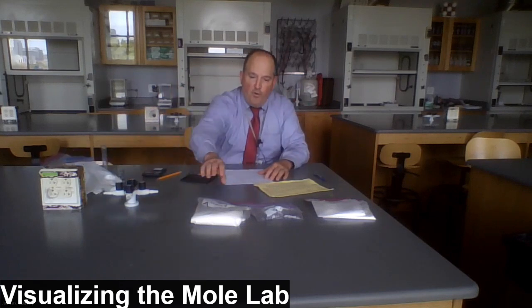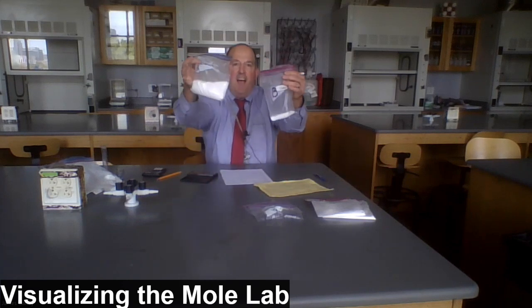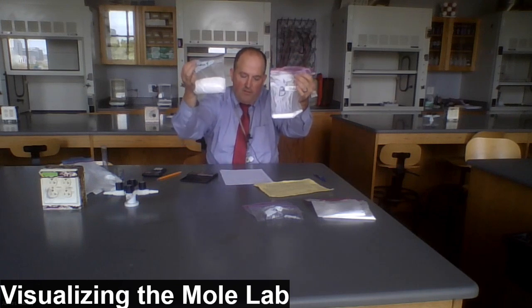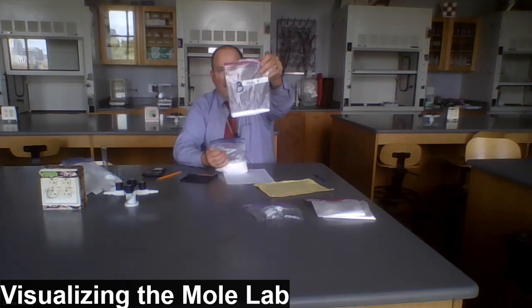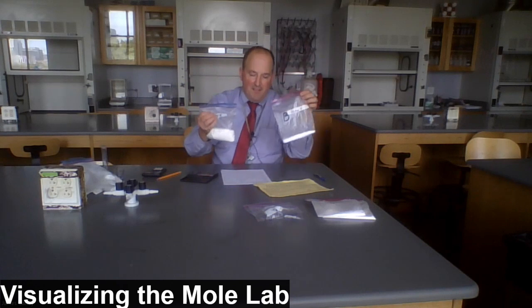On to station 4. Take a look at these. First of all, the size of these 2 samples. This one is especially large. Sample A is a bag of a 1 mole sample of either salt, sodium chloride, or sugar, sucrose, C12H22O11. Sample B, again, is a 1 mole sample of the other thing. Whatever A is not, B is.